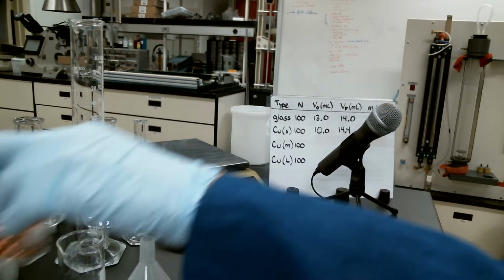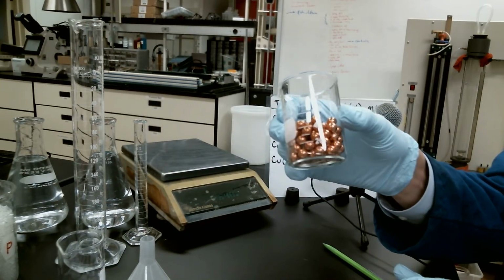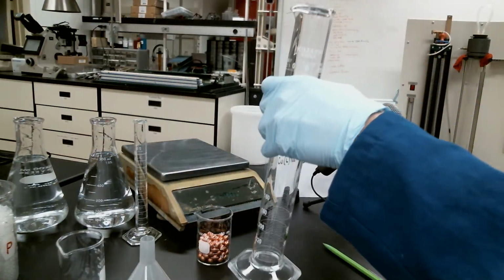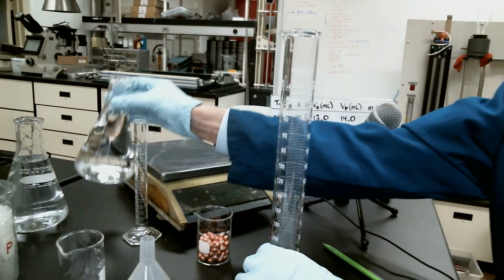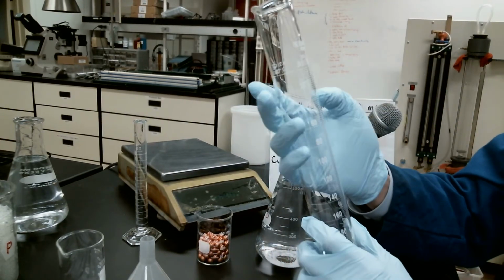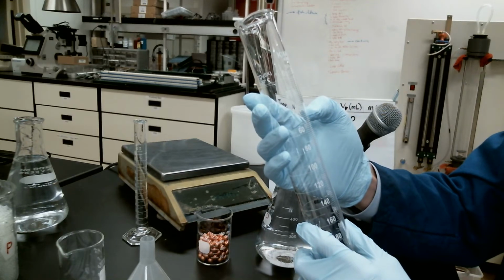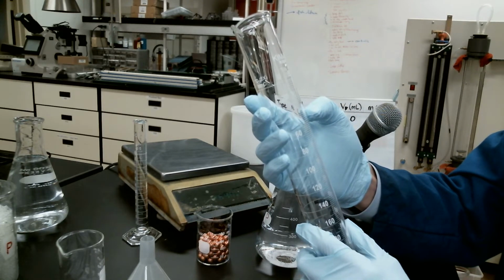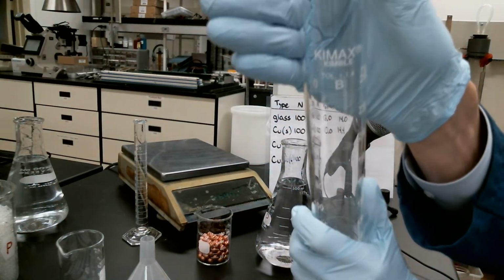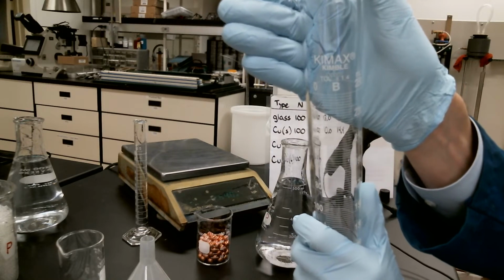And then we're going to move on to our larger copper spheres, which are actually, these are the medium-sized copper spheres. So we're going to add some water to our larger graduated cylinder here. This one goes up to 250, and it appears to go, let's see, in increments of, that would be 10, about 2 milliliters. So increments of 2 milliliters. However, the tolerance, which can be a little bit hard to see, right here at the top, you can see the tolerance actually says 1.4 milliliters.